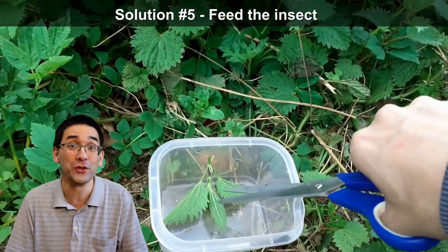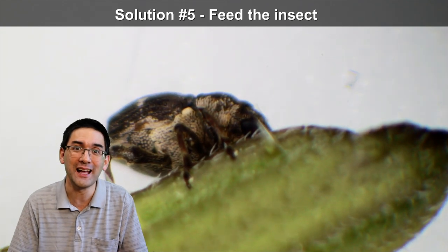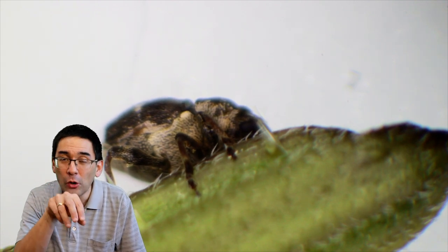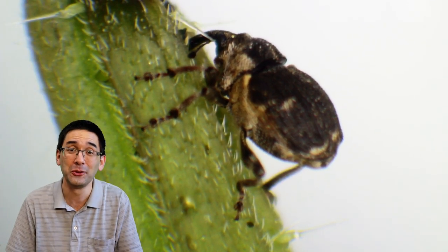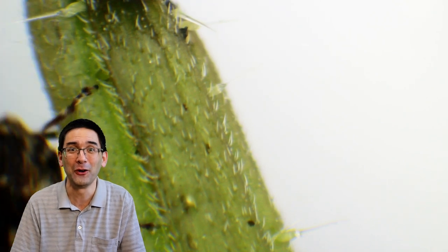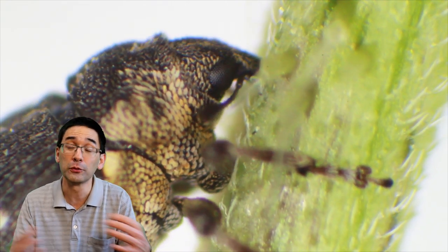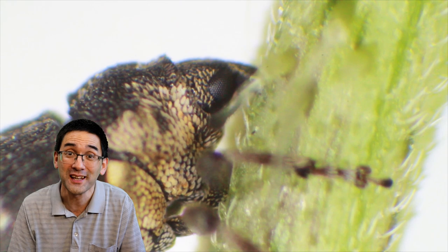My favorite method is to make sure the insect is feeding on something, because when it's feeding it doesn't run away as quickly. I collected some stinging nettle and on it there was a little beetle with a long trunk — these are actually called snout beetles, and they have this long snout for sucking the sap of the plant. This is how I was able to make these videos: the insect was simply concentrating on feeding on the sap, which made it much easier to get nice video footage and observe the fascinating life of the insect.